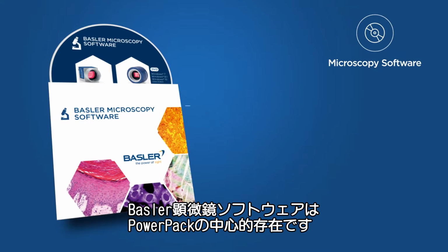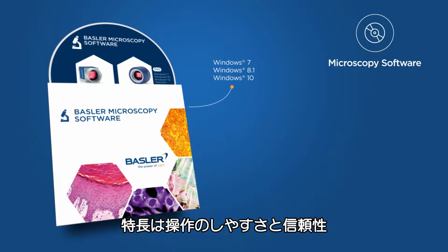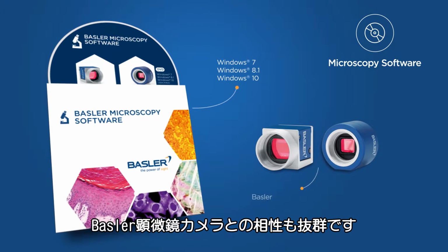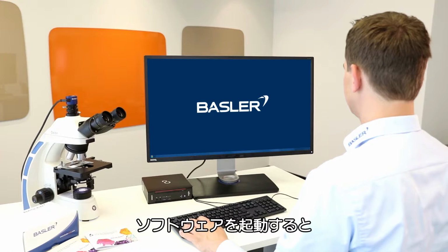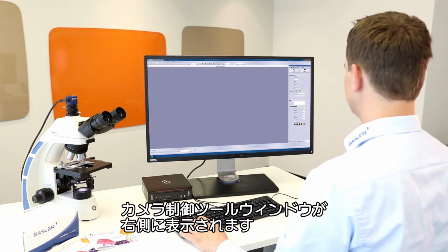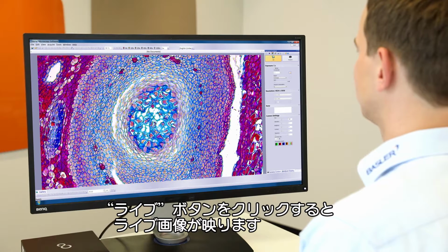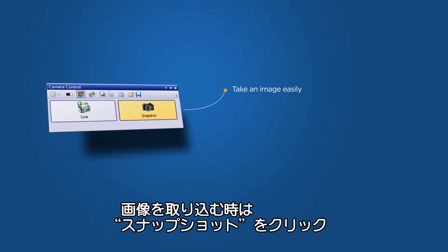The Basler microscopy software is a centerpiece of the Power Pack. It's designed for easy handling and reliable performance and is well matched with the Basler microscopy cameras. When starting the software, you'll find the camera control window on the right. One click on the Live button and the live image appears. You can take an image by clicking on Snapshot.